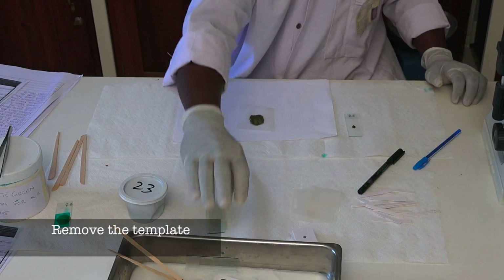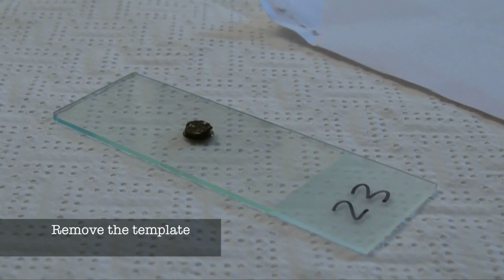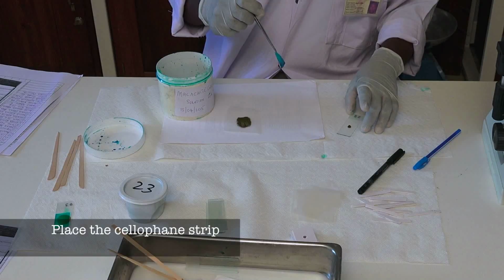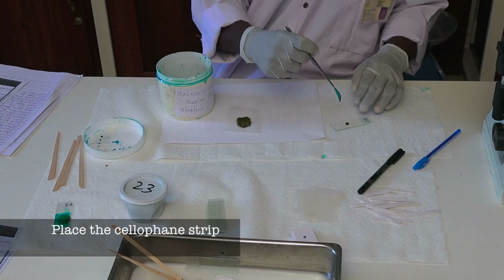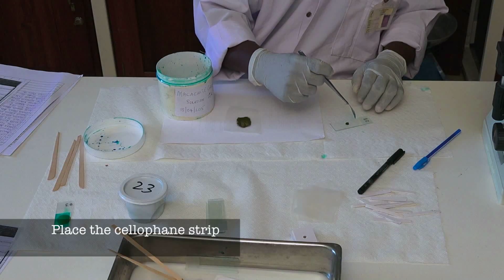Remove the template carefully so that the cylinder of feces is left on the slide. Using forceps, take one pre-soaked cellophane strip and cover the fecal material with it.